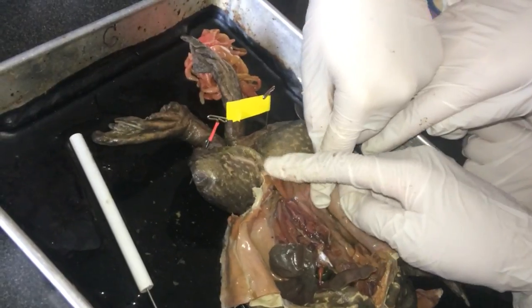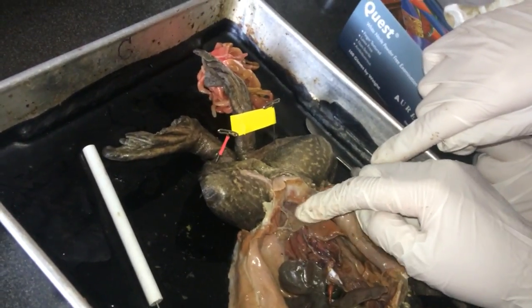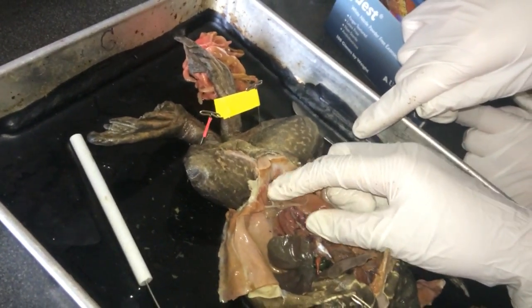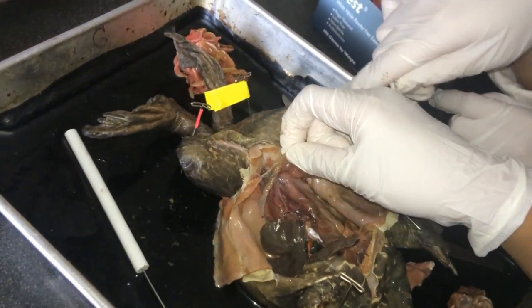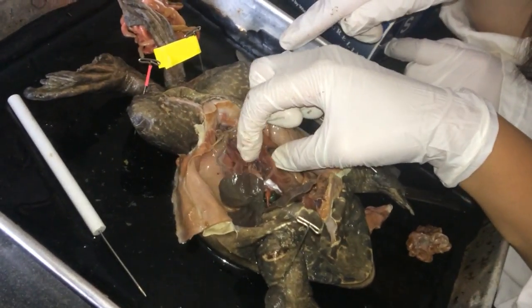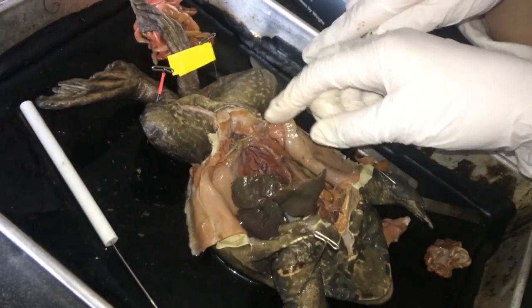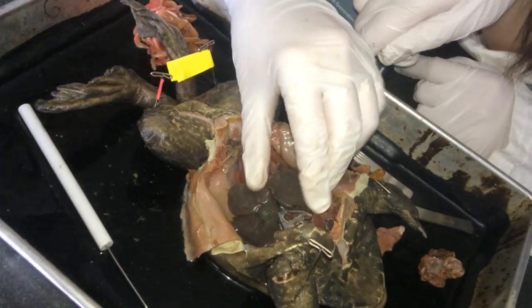Where is the testi... oh, is it down here? Yeah. I don't think so, because remember, the fallopian tubes were like all up in everything. So, if there are fallopian tubes, then it's... yeah. It's actually a guy, but the testi... I don't know what that is. So I think these are the kidneys.